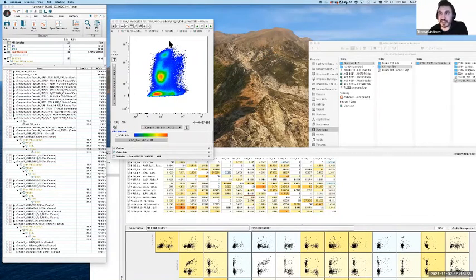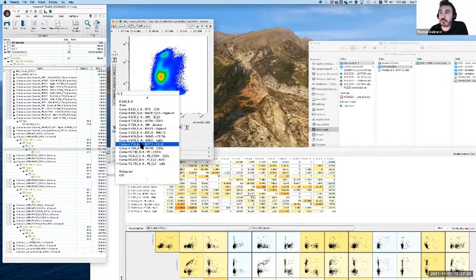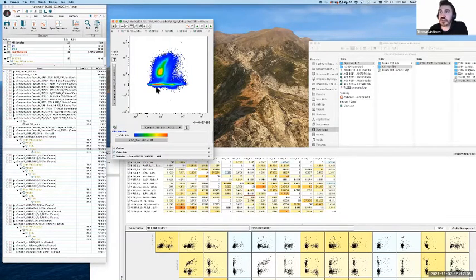The FMO gives us that confidence of being able to make those measurements and those comparisons in a way which is accurate. If we don't have the FMO, then we could have markers that lean because that's just in the nature of their biology. And I think the key thing there in terms of the pattern we want to look for, which at least gives us a clue of where to go, is that mathematical relationship.